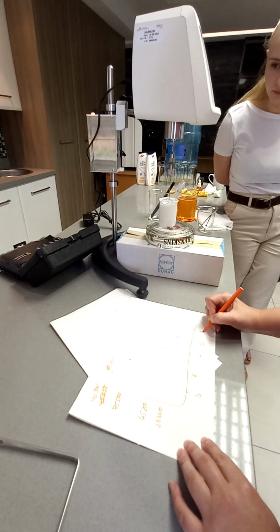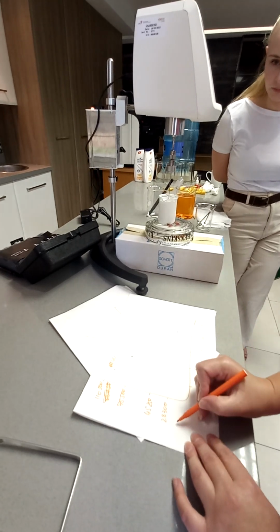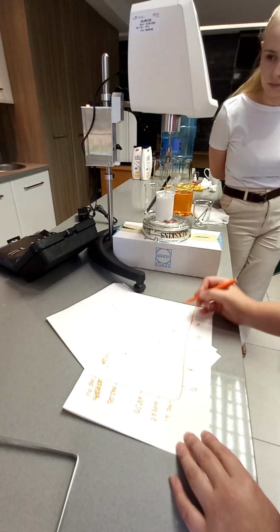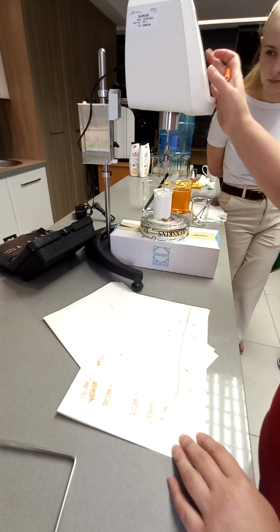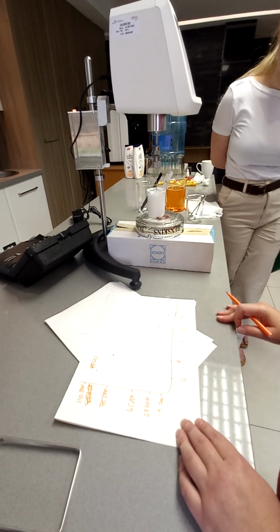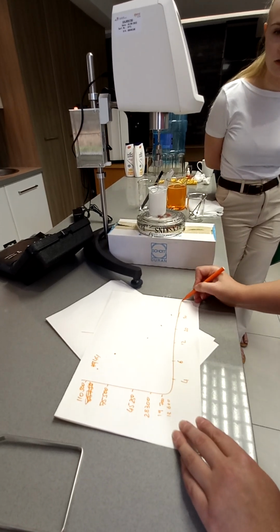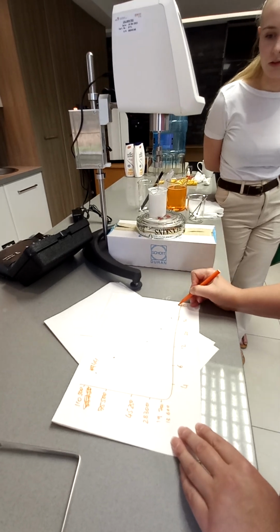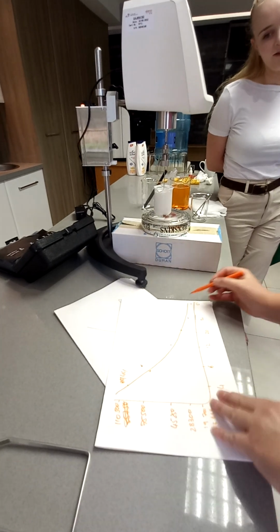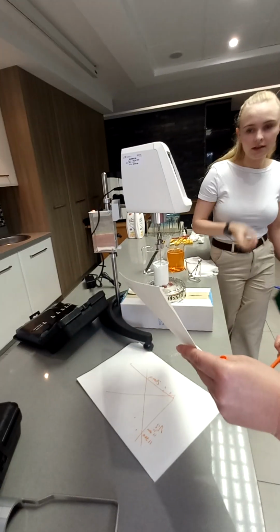So 30. Let's do one more speed. 50. Sorry, it may be better in Excel. But in any case, I think that point should be there. So we'll get that. At a stage it will flatten out the more you shear it. Okay. So that is what we got.